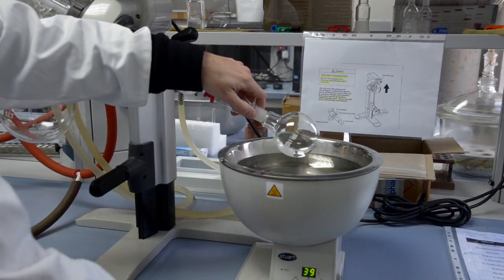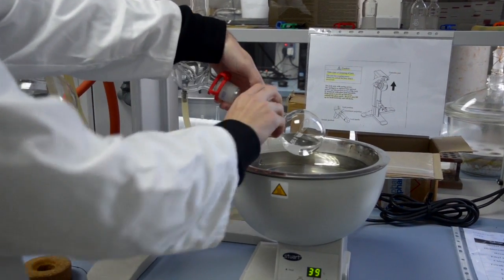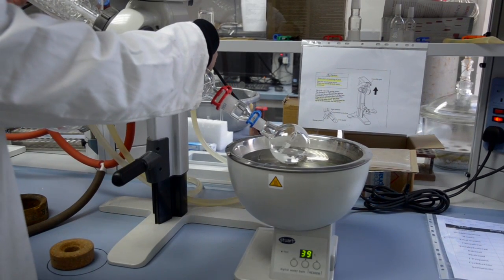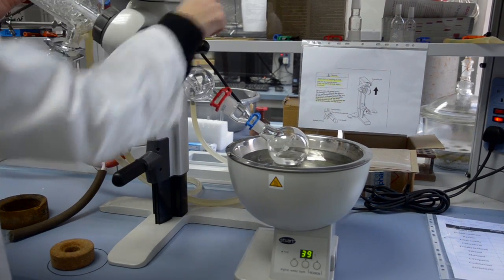Connect your flask, clamp it and ensure the angle and height of the rotary evaporator are sufficient to immerse the flask effectively within the water bath.